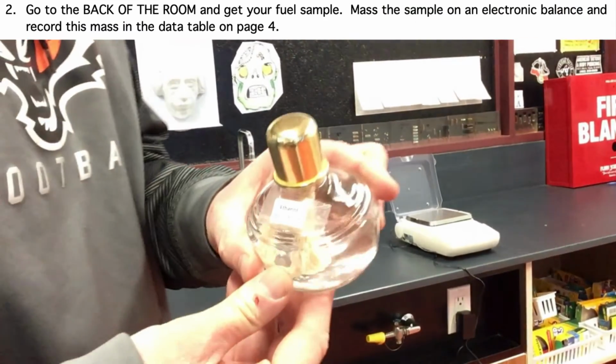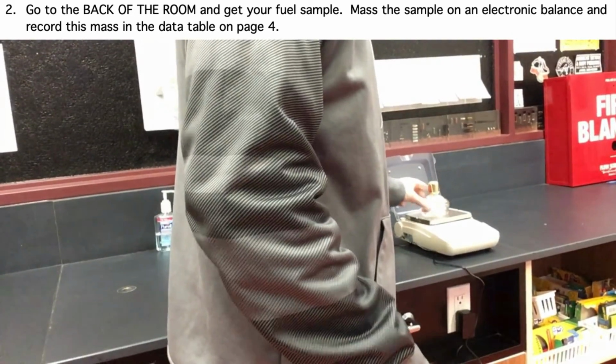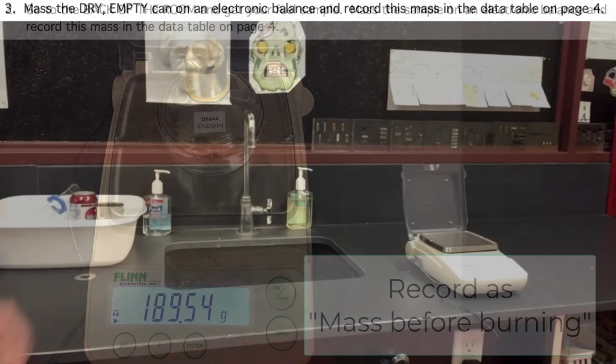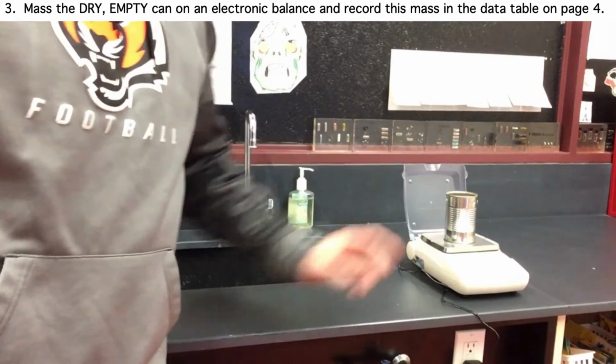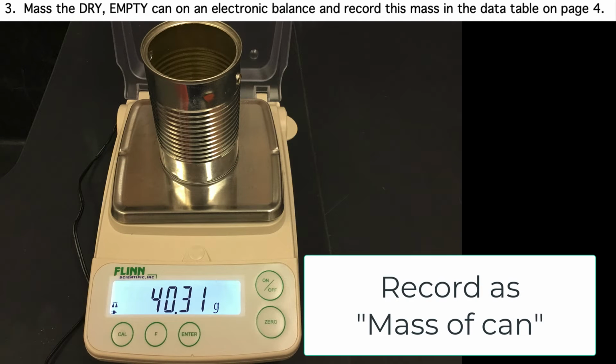The fuel we will use for this lab is ethanol. First, we will mass the ethanol container before we burn any of the ethanol. Be sure to record this value in the data table on page 4. Next, we will mass the can empty. Be sure to record this value in the data table on page 4.